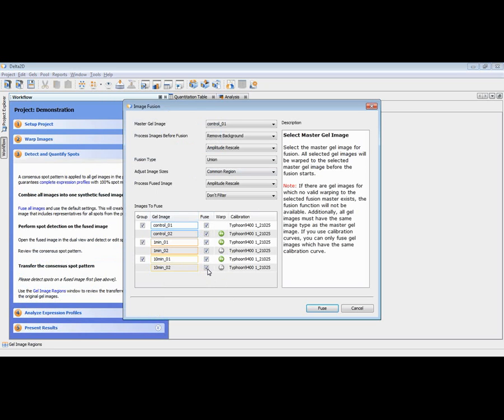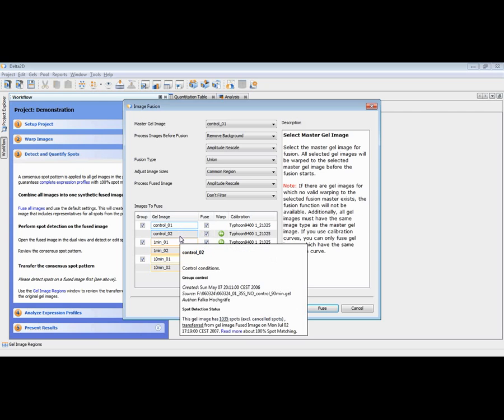If you have a large number of replicates and know that the replicates are very well reproduced, then you can exclude certain images from the fusion, because having the same image twice doesn't help or doesn't improve the quality of the fused image.